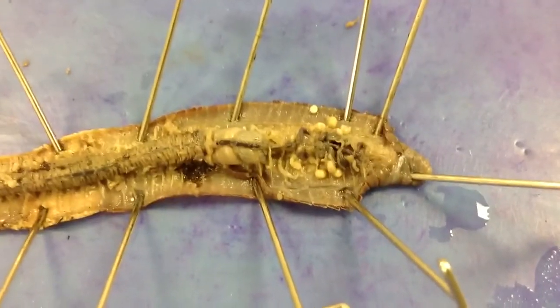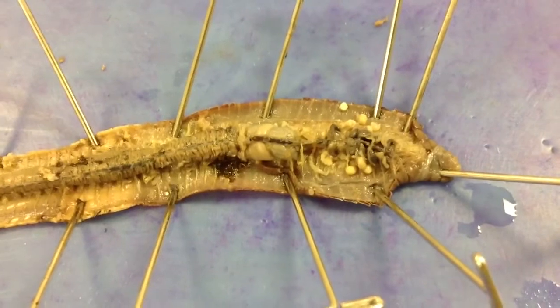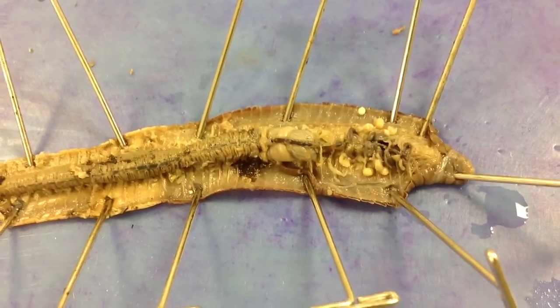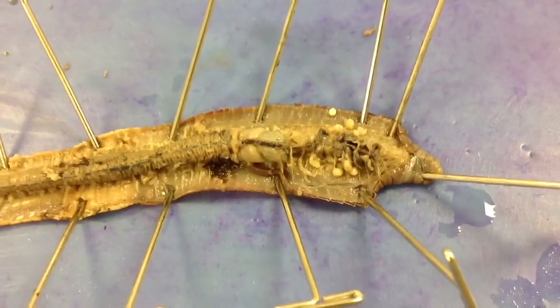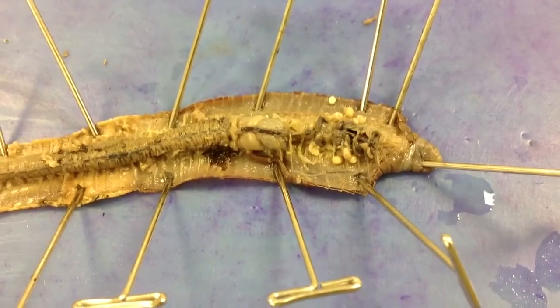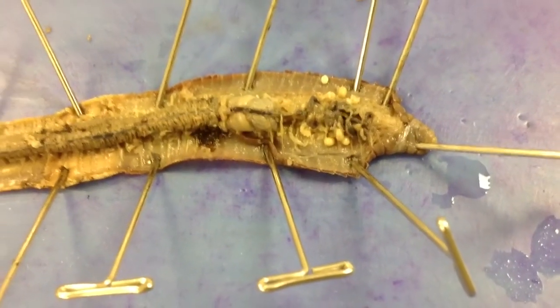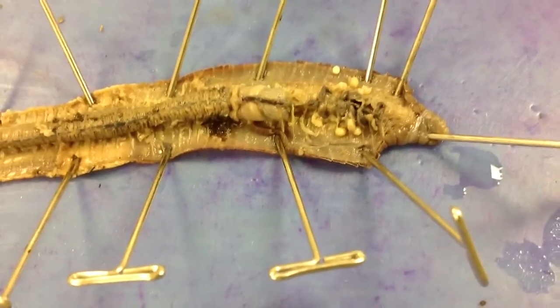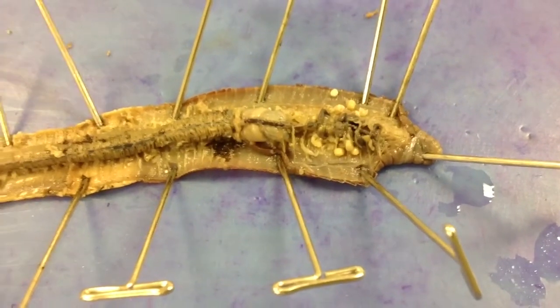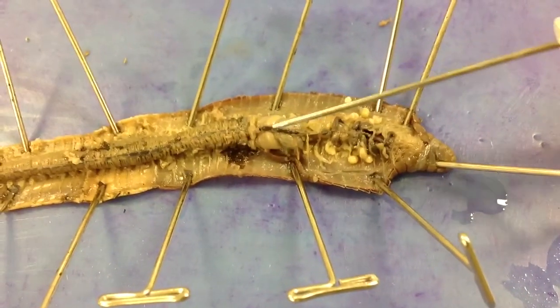We've removed the larger white structures — those were the seminal vesicles, reproductive organs. When we remove those, we can more easily visualize parts of the circulatory and parts of the digestive system that we really want to focus on.